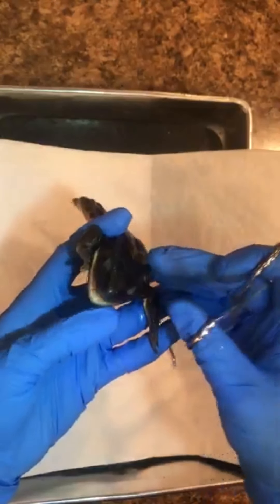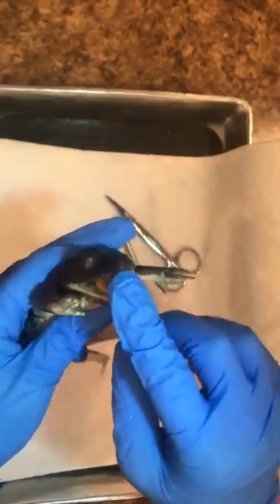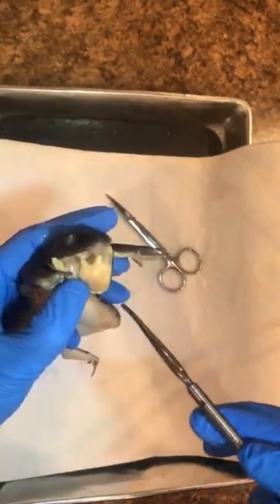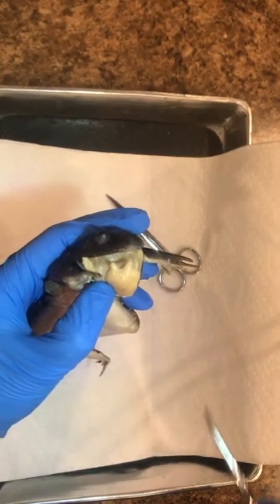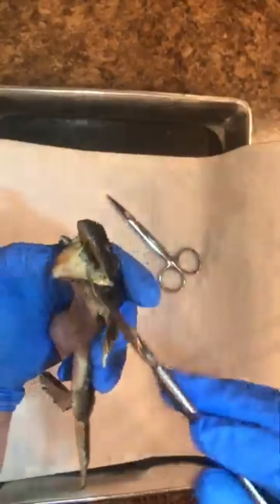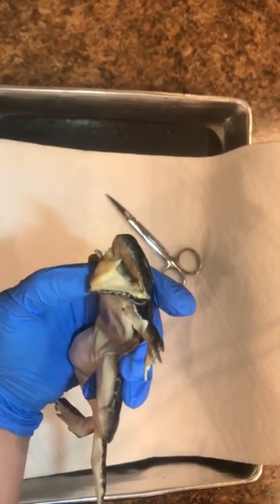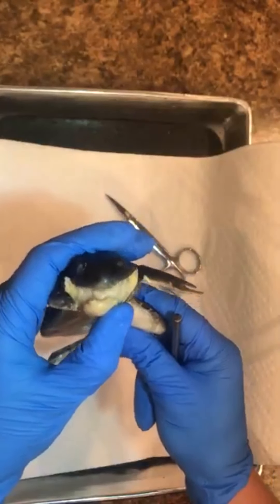Inside the mouth, the tongue is the frog's most noticeable feature. It's called a cleft tongue — you can see its cleft shape right here. It's attached at the front of the mouth and free/flappy in the back, which is the opposite of our tongue, which is attached in the back and free in the front. This is one of its adaptations for catching prey — it can flip out from the front attachment to snag insects.